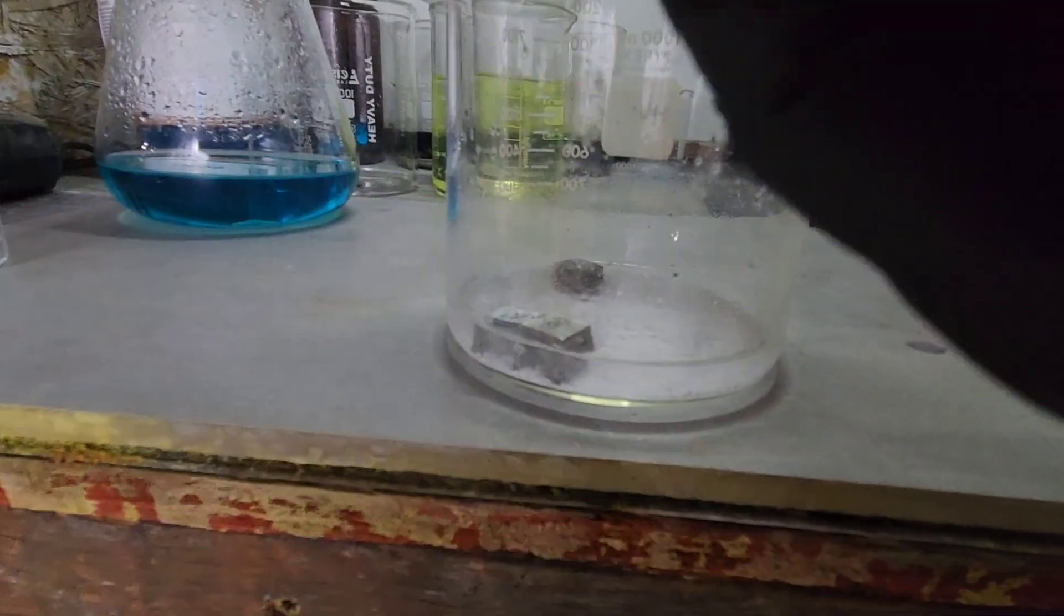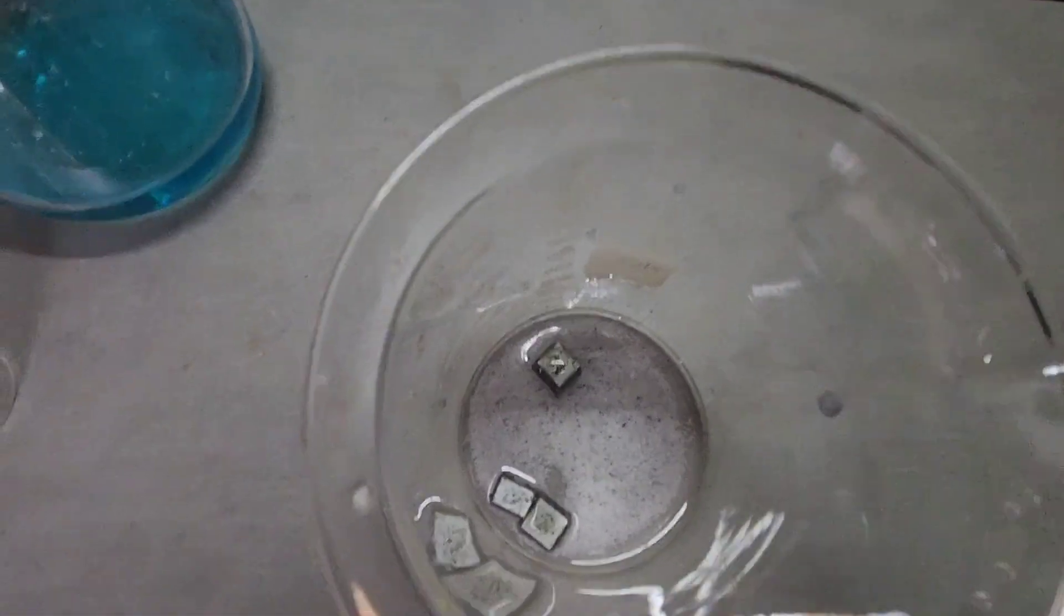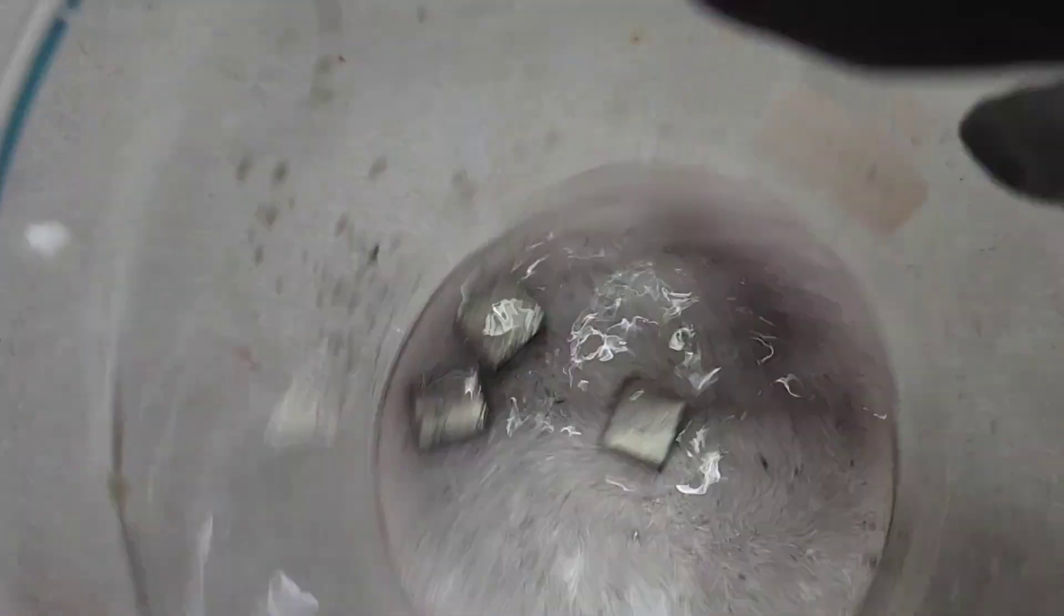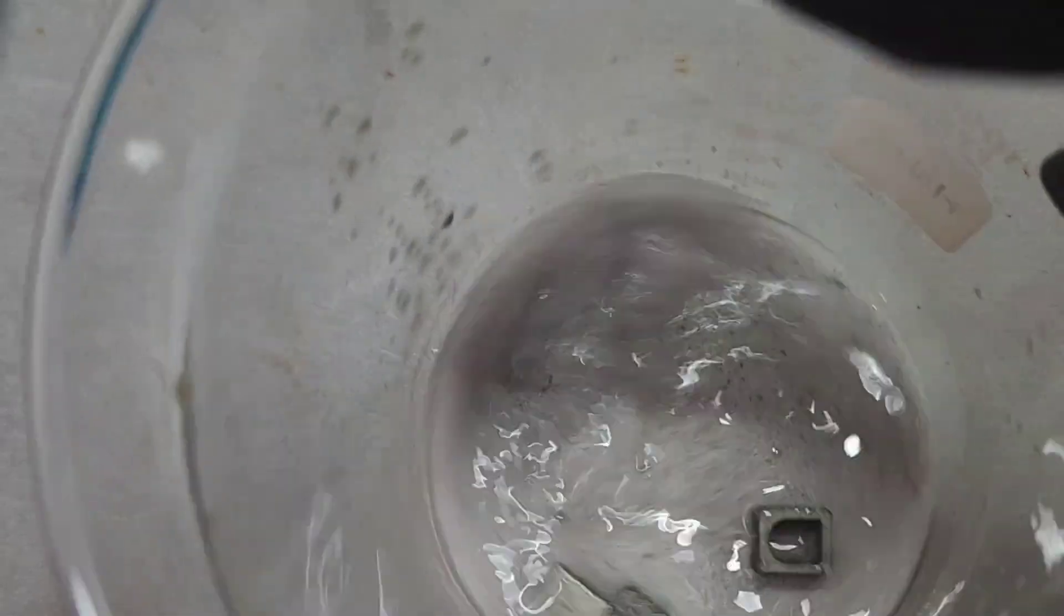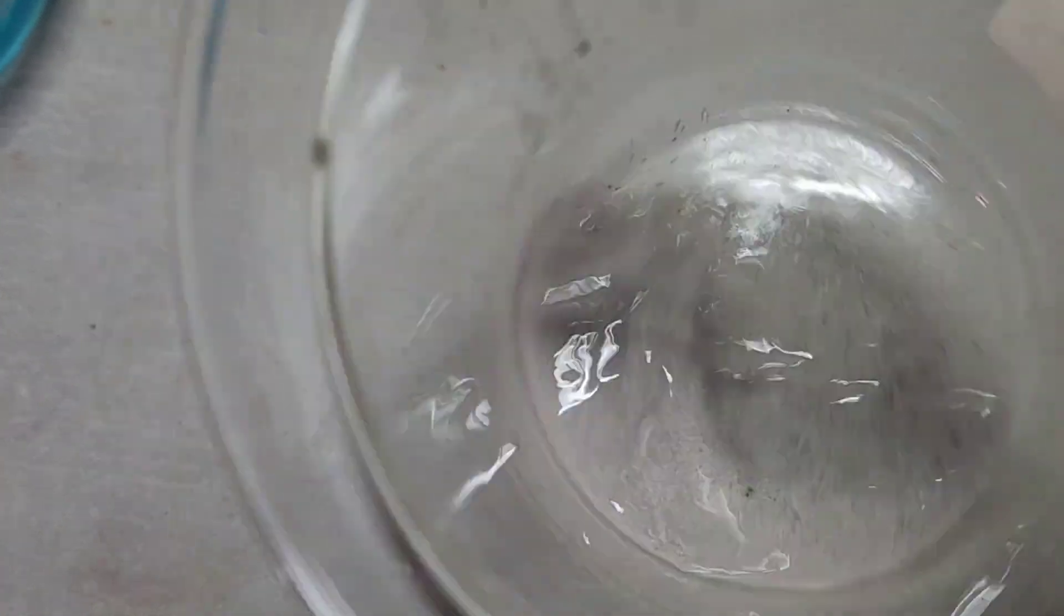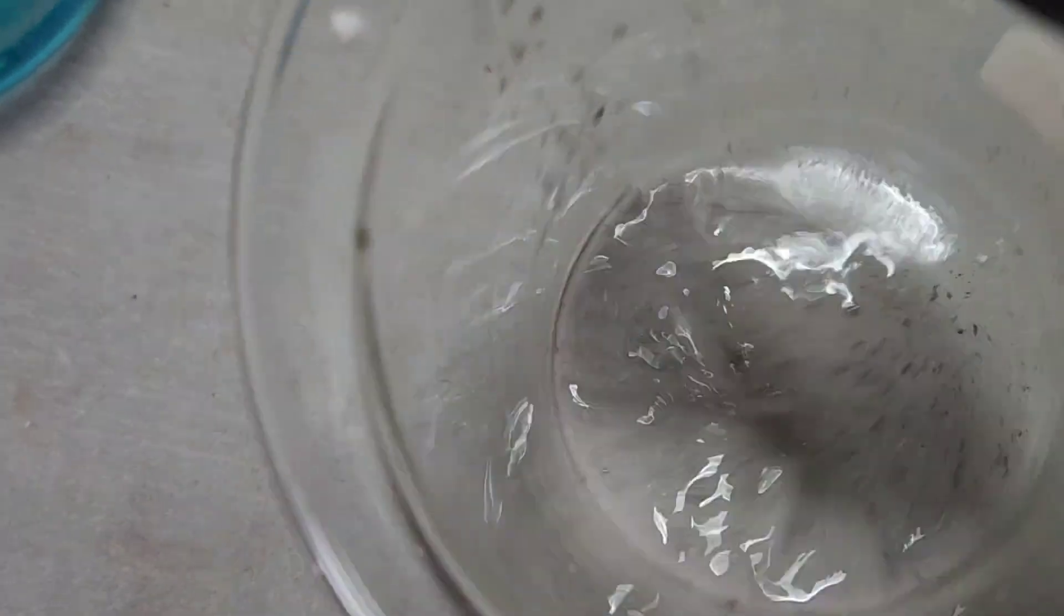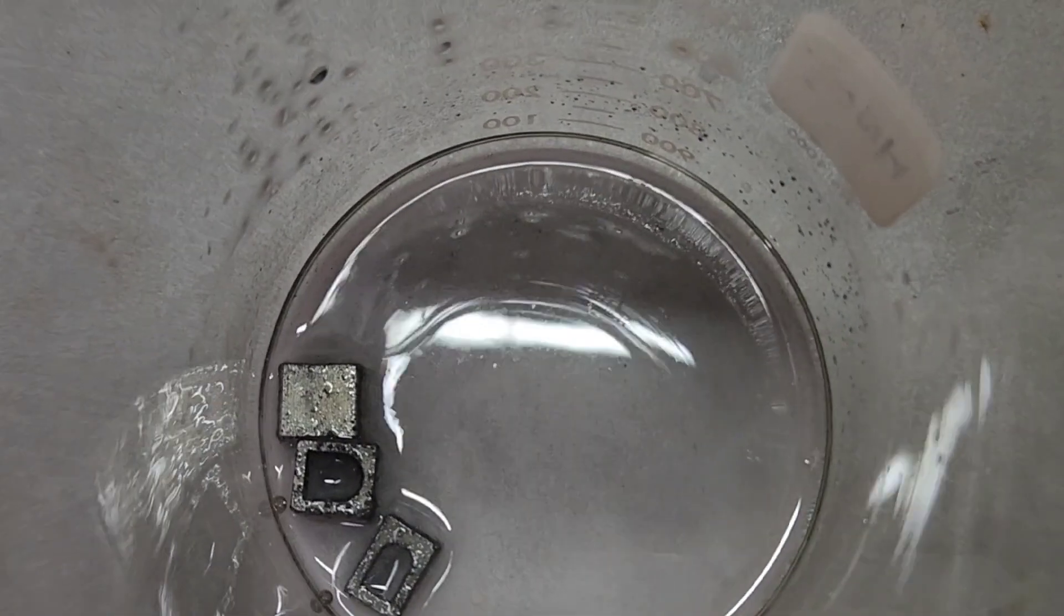Let's see here. We can see right off the bat we've got some change. We can see our silver starting to darken up and see the darker spots.